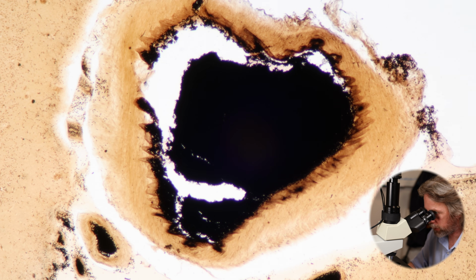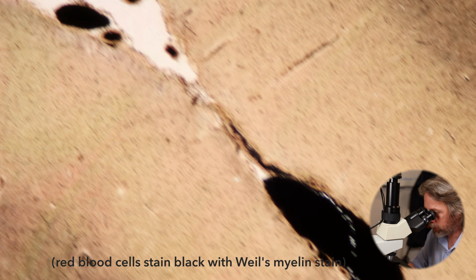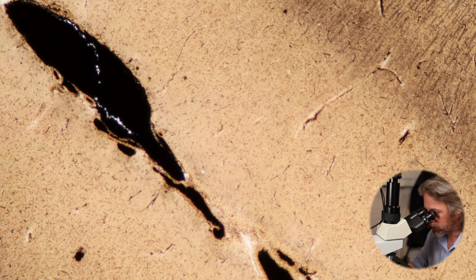Ooh, so are the blood vessels staining black? I don't know much about this stain, I'm just guessing that's what it is. Maybe I should have looked this up beforehand. Anywho, so maybe we're seeing lots of blood vessels in there with those streaks. Anywho, so if that is a sulcus, then this is the outer edge of a gyrus.